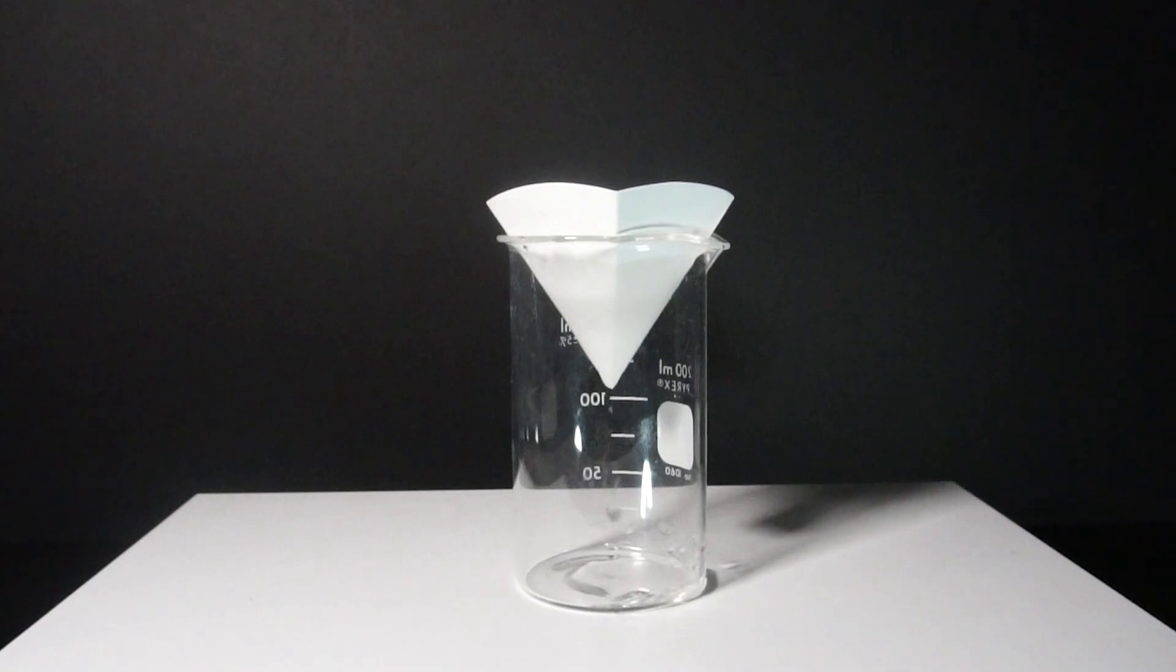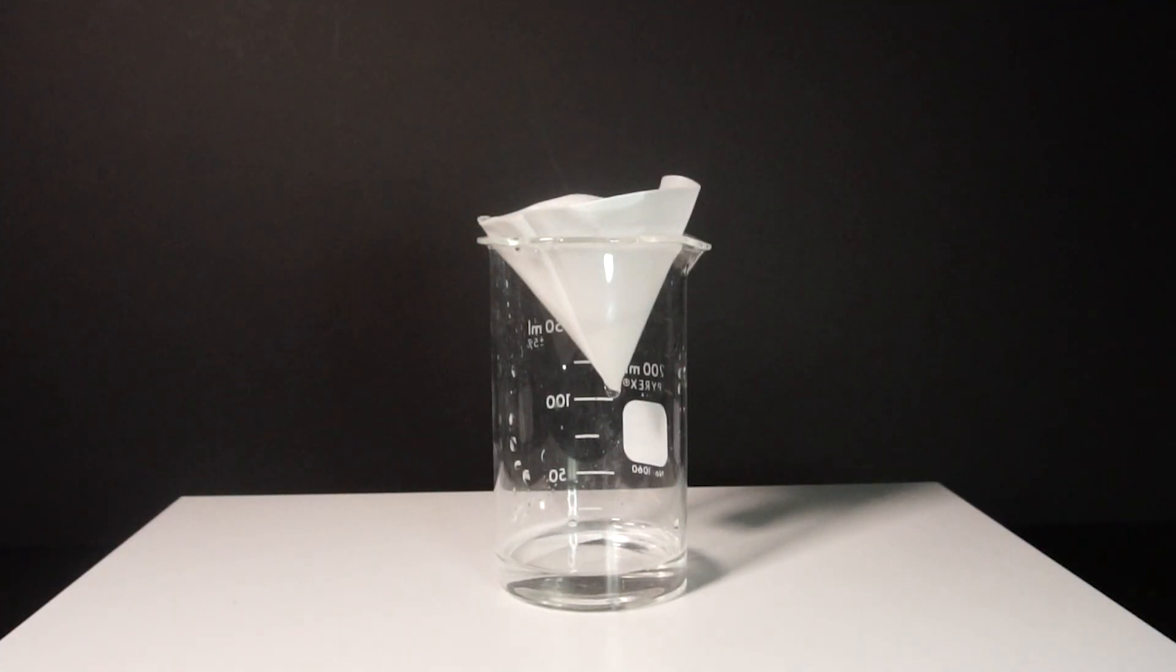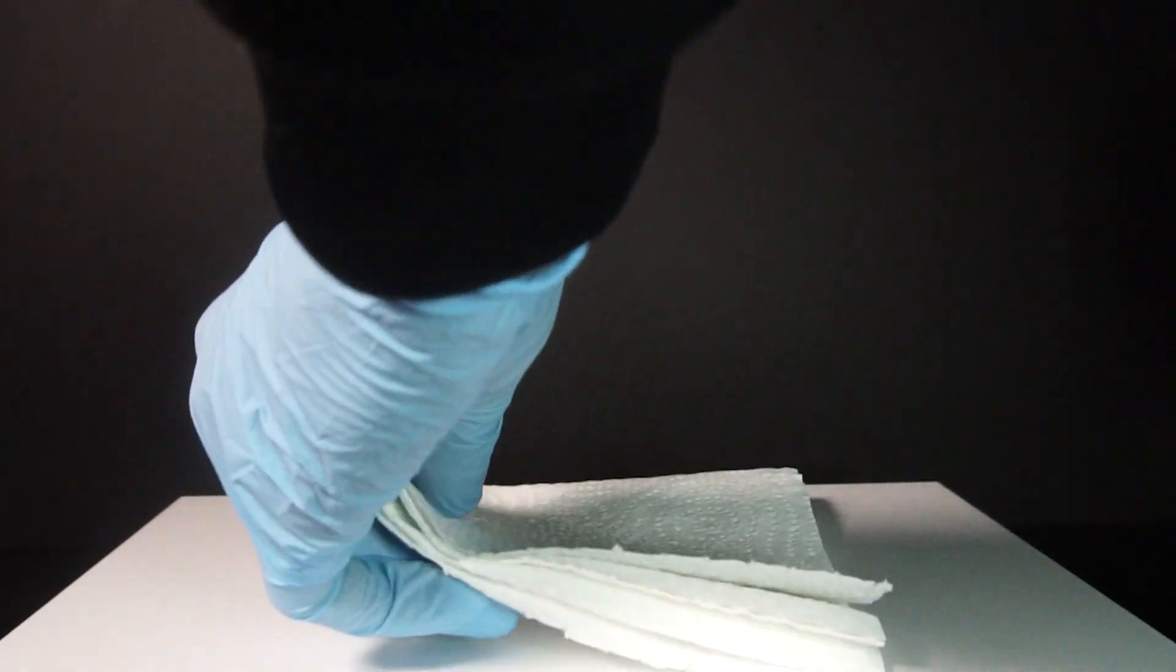From here I dry everything out and to do that I just place some paper towel out and set the filter paper on top of it.